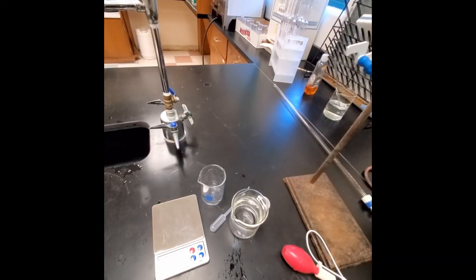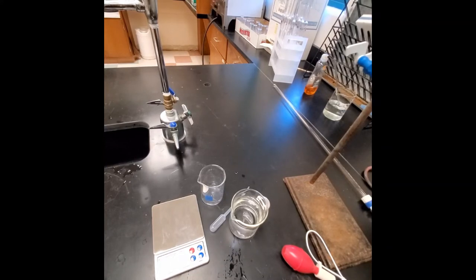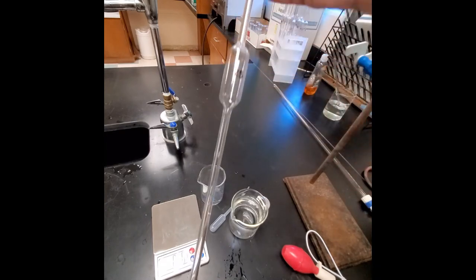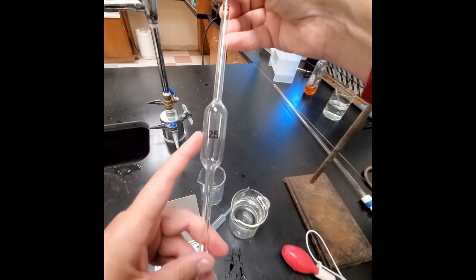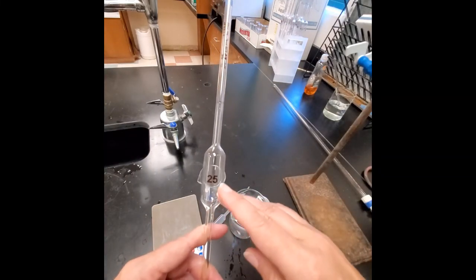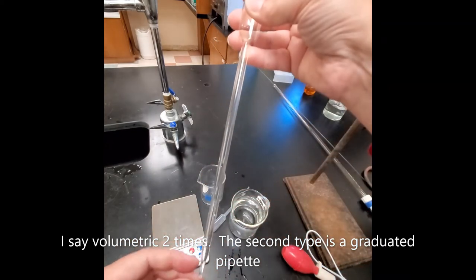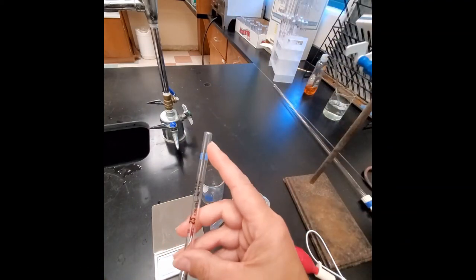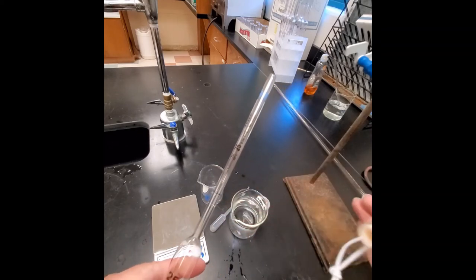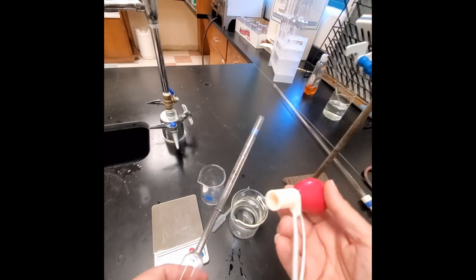The second part of the lab uses equipment designed to deliver a set amount of solution. This volumetric pipette looks like a large straw with a bulb in the center. It can be volumetric — delivering a fixed volume — or graduated, with markings for varying amounts. It has a small tip on one end and a larger opening on the other. To get liquid in, we use a pipette bulb.